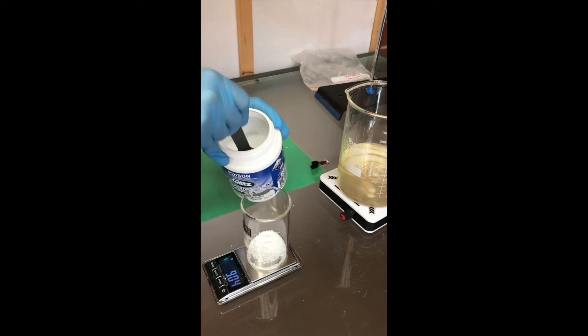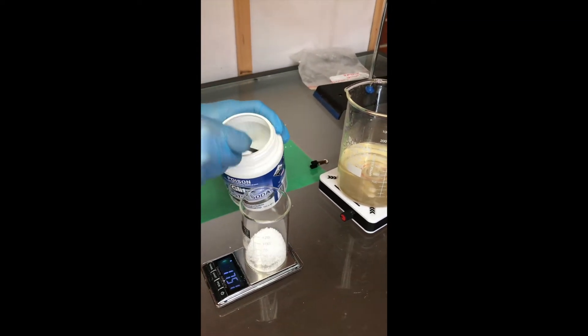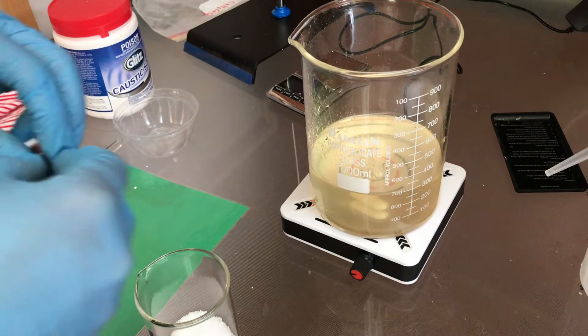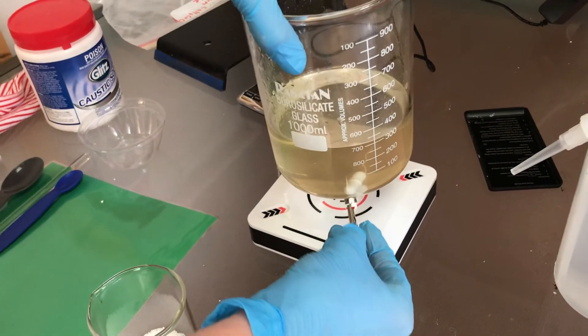I will now use a beaker and weigh 26.8 grams of sodium hydroxide. I like to ensure that it is cleaned properly so there isn't any cross contamination.